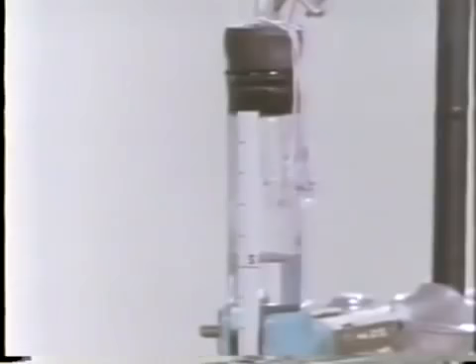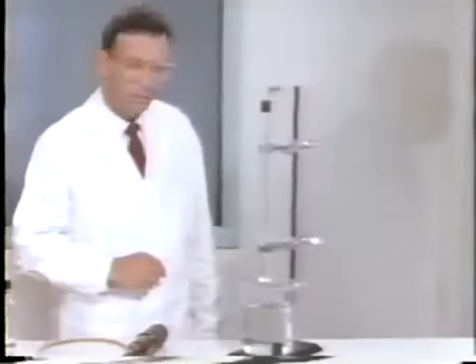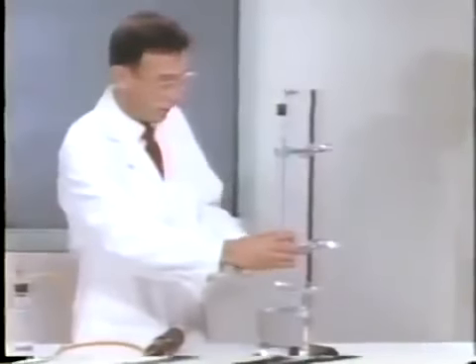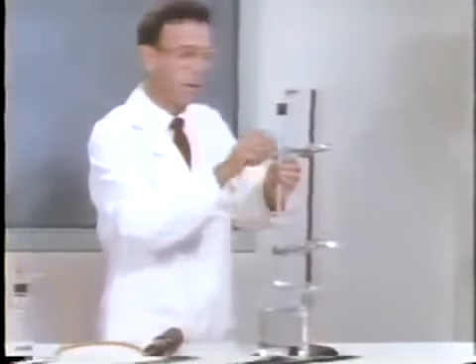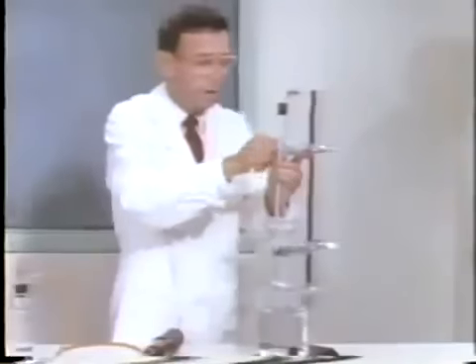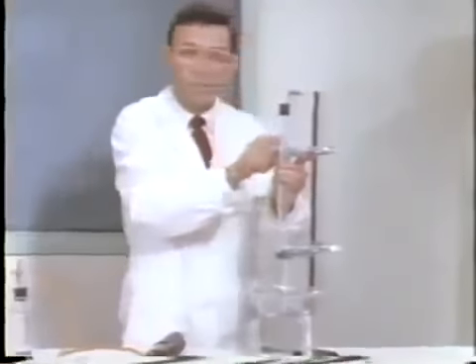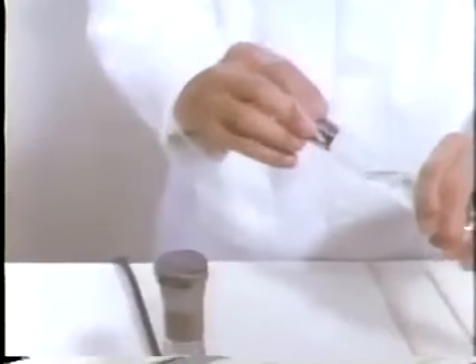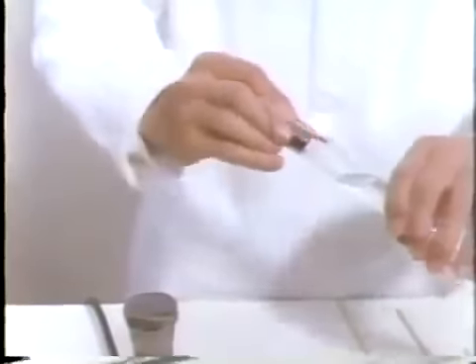The scale reading is 4.9. After that spectacular reaction, some gas remains. Water from the beaker has risen in the tube, taking the place of gases consumed during the explosion. The gas that remains could be hydrogen, oxygen, or some other gas. Perhaps a splint test will give us a clue. You recall that hydrogen caused a small explosion, whereas oxygen caused the splint to burst into flame. The gas behaves like oxygen.